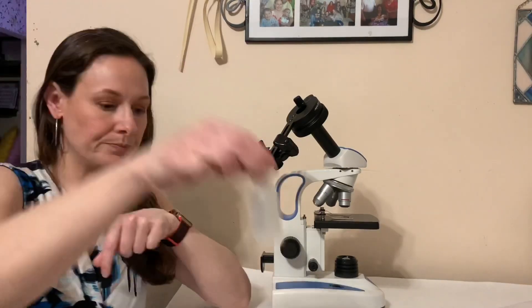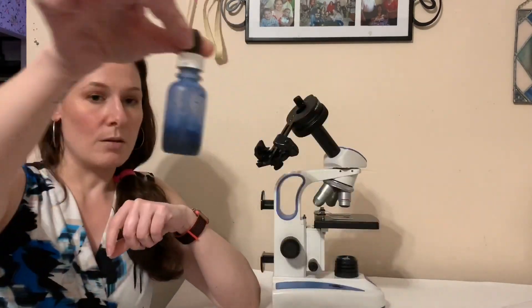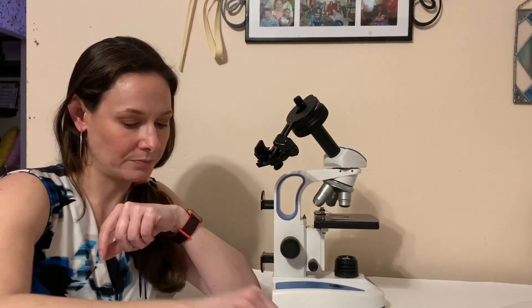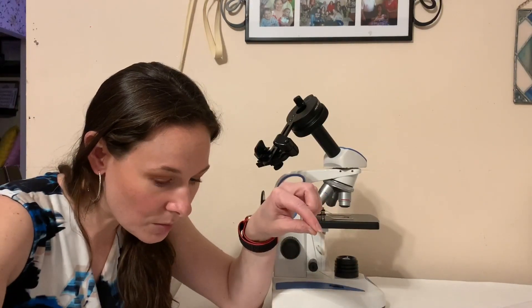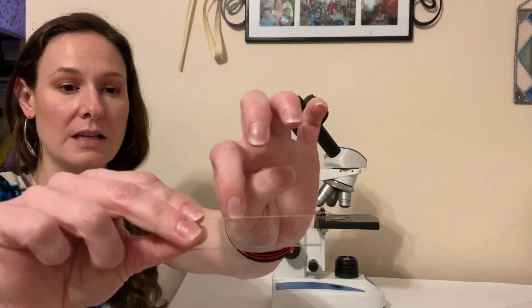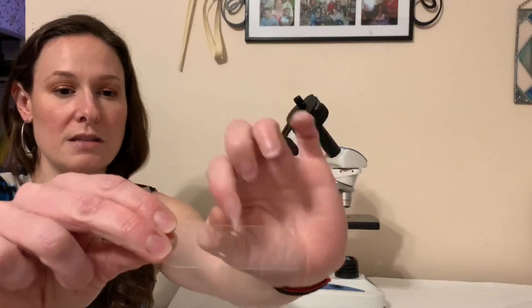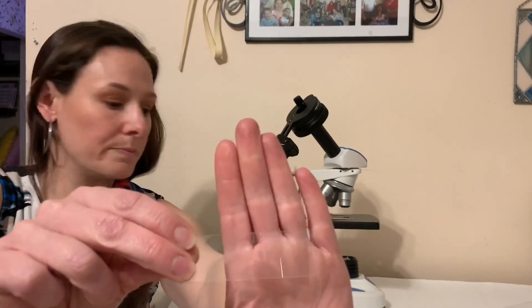I have water for my slides, bromothymol blue, a pipette, and slides that have little divots in them so that we can see thicker things and put them under the compound microscope without having to use a stereo microscope. I'm going to make these slides and I'll be right back.